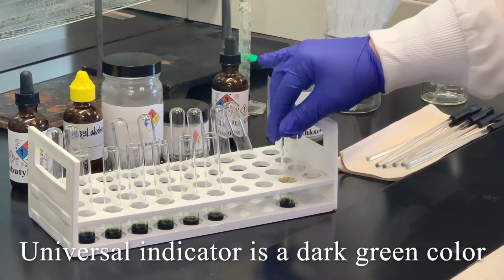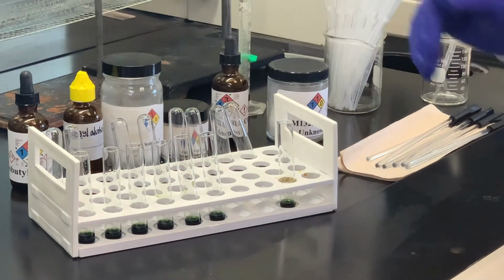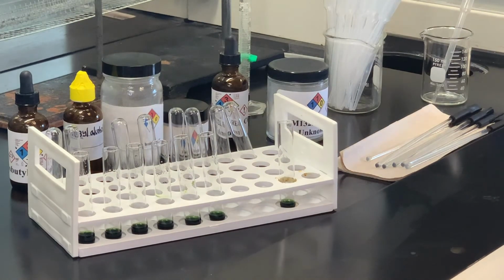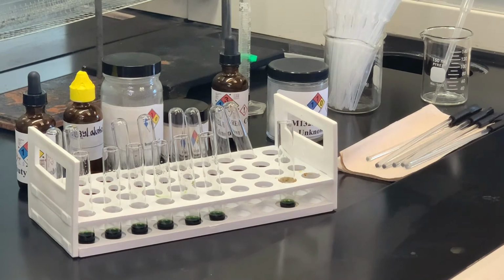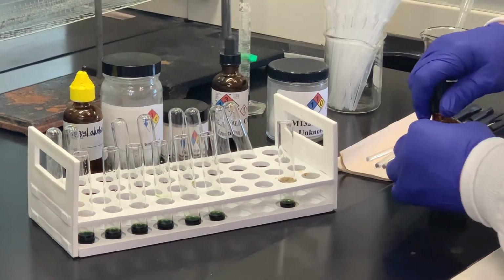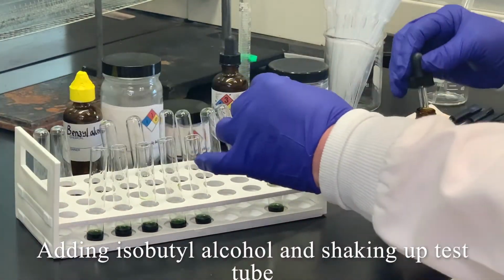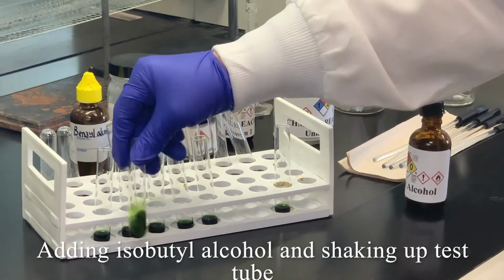So what I've done is to put about 1 milliliter of the indicator into these separate test tubes, and then what I'm going to do is go back and add a few drops of each. If it is a liquid, add a few drops of the liquid, and then close to about 30 milligrams if it's a solid. We'll stir those well, and then we'll take note of what color we see in that test. So the first one I'm going to do is the isobutyl alcohol. And I'm going to shake that pretty well.